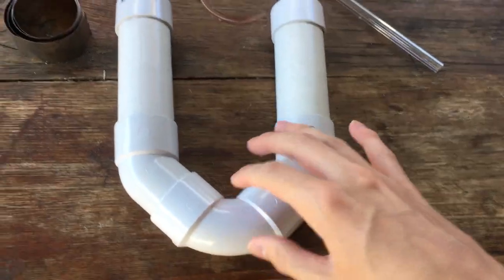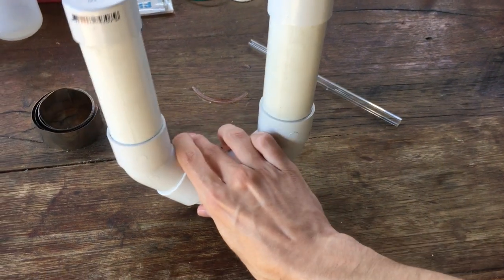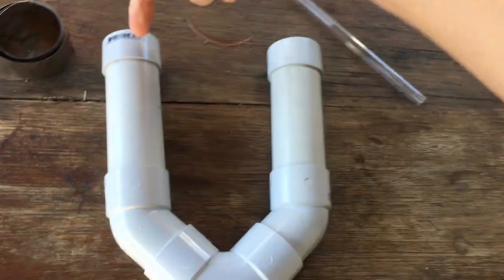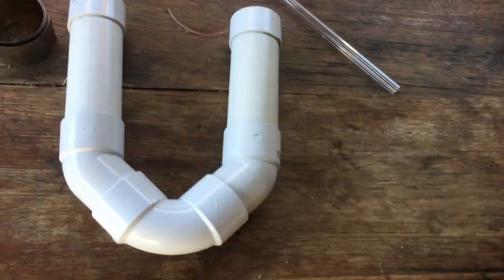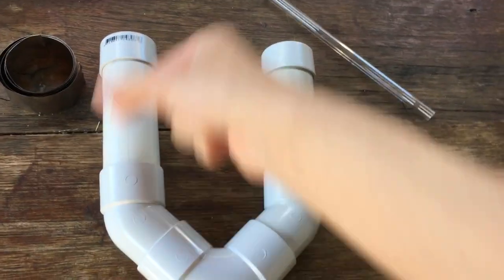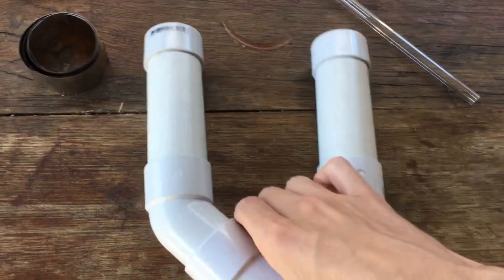We'll fill this with a sodium hydroxide solution, stick an electrode down — each one of those has the electrodes right down here — and we should be able to generate hydrogen and oxygen gas from those electrodes.